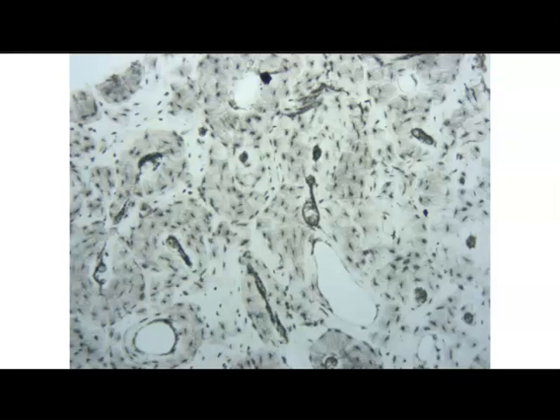So here we can see some osteons. Here's the central canal. We can see the concentric lamellae surrounding the central canal of the osteon. And then within the concentric lamellae, we'll see the darker staining cells. These are the osteocytes sitting in their lacunae. You can't really see the lacunae too much in this type of objective, but we know that these spider or ant-like cells, those are the osteocytes.